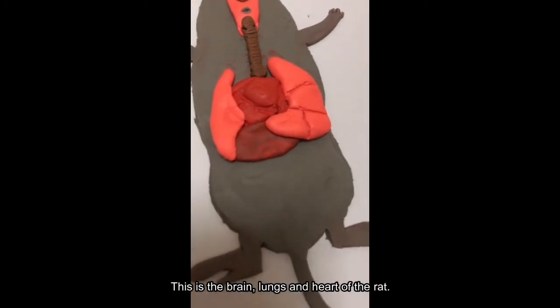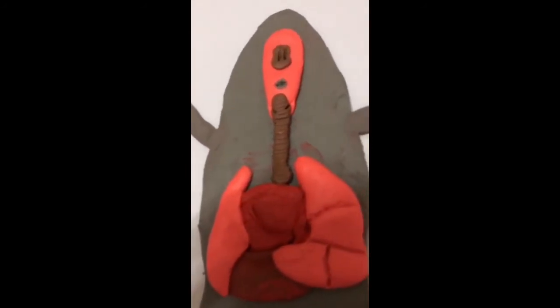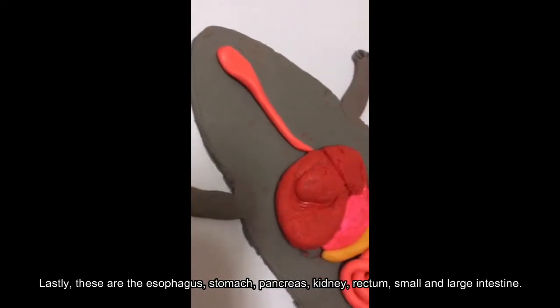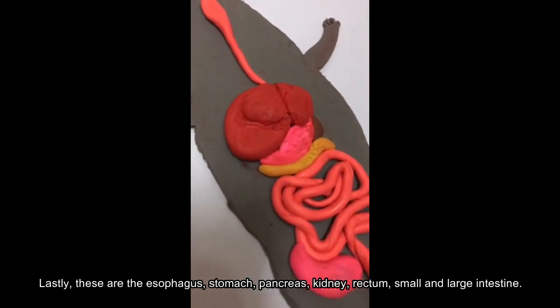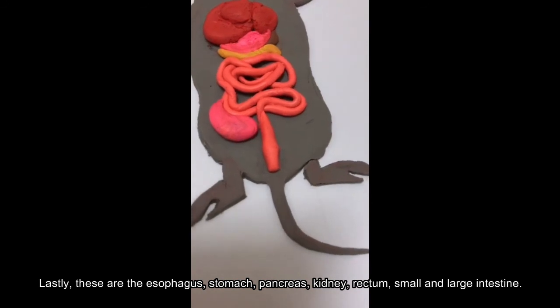This is the brain, lung, and the heart of the rat. Lastly, these are the esophagus, stomach, pancreas, kidney, rectum, and the small and large intestine.